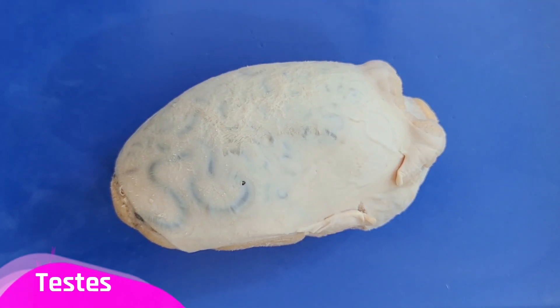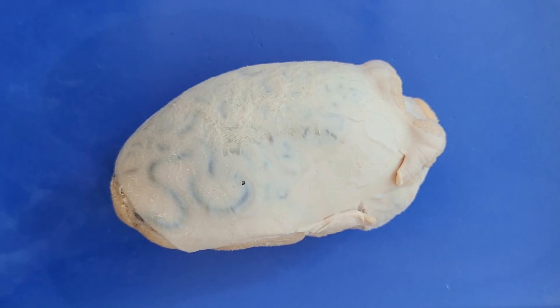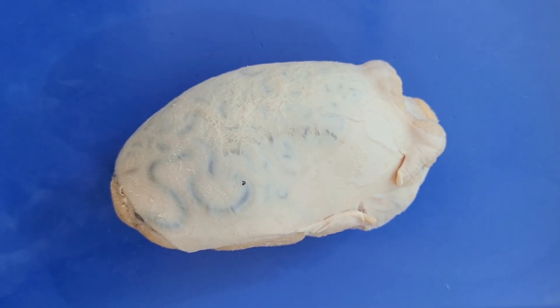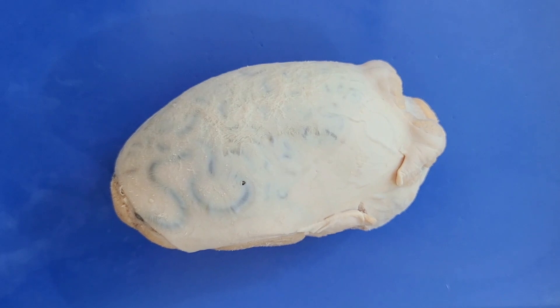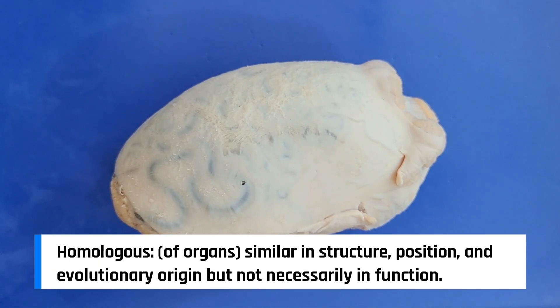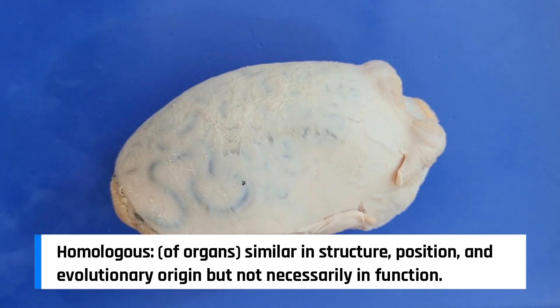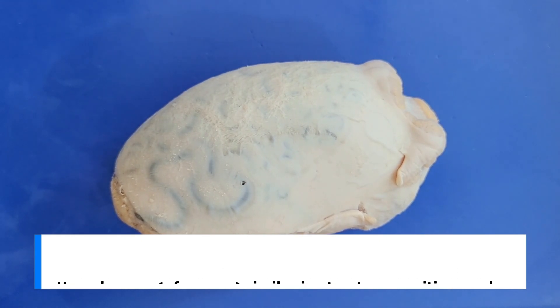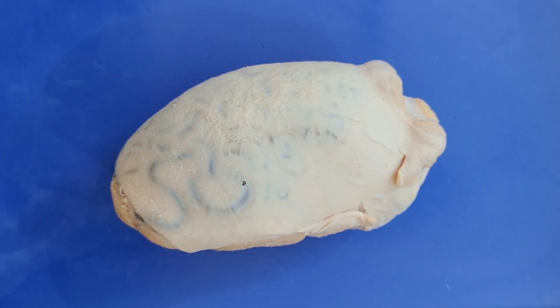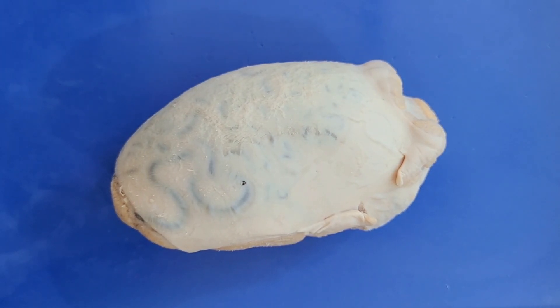The testes is the meat and potatoes of the male reproductive system — it has the crucial function of producing sperm cells. It's homologous to the ovaries in the female reproductive system, which produces egg cells. The testes differ from the ovaries in several key ways, even if you don't count the obvious sperm vs. egg difference.